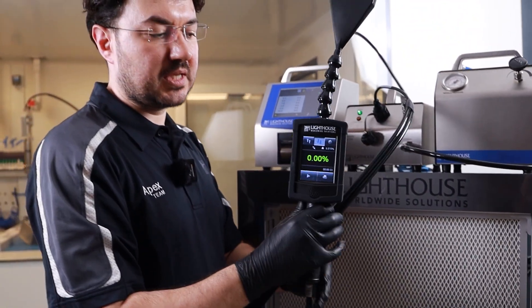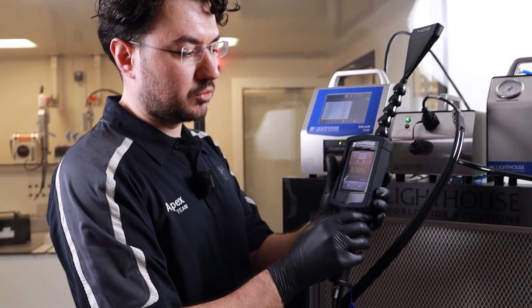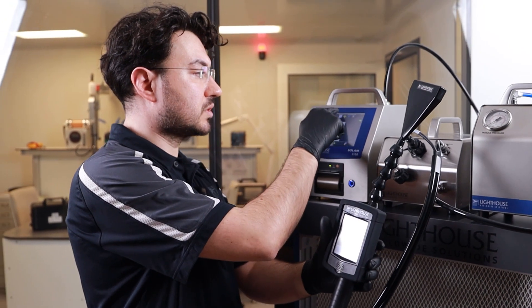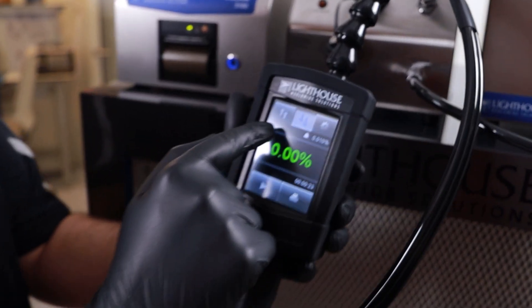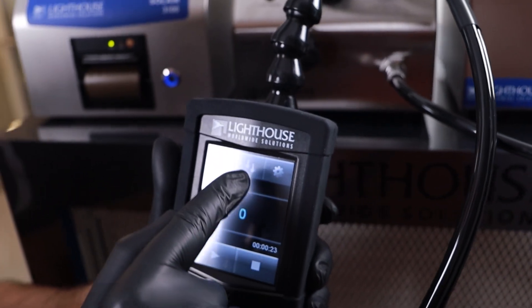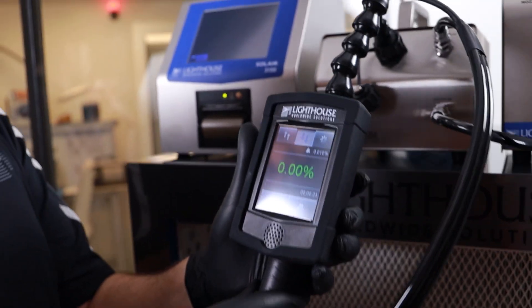which is our filter scanning probe. This filter scanning probe, when the particle counter is connected to the filter scan mode, it takes the control and you can easily switch from upstream to downstream sections.